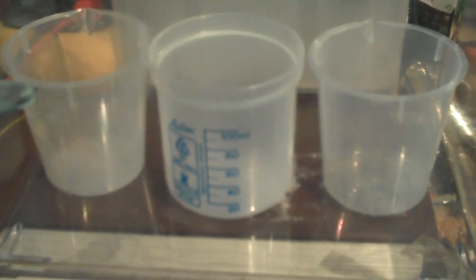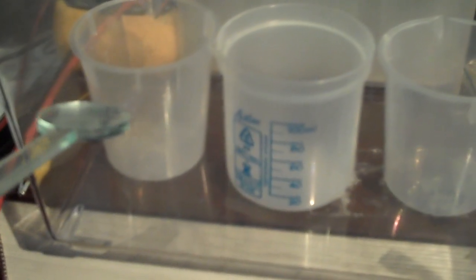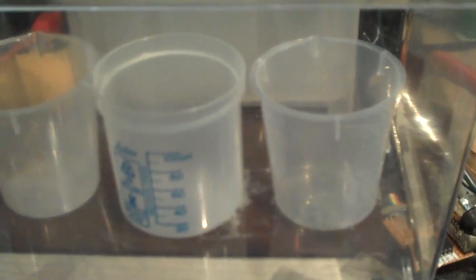On each of these containers that hold the etch and the rinse water, progressively put more water in the next ones. So if there's any acid that gets up onto the wand, you can wash it off on the final stage.